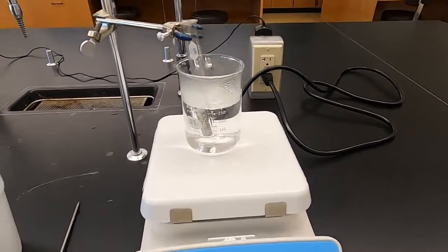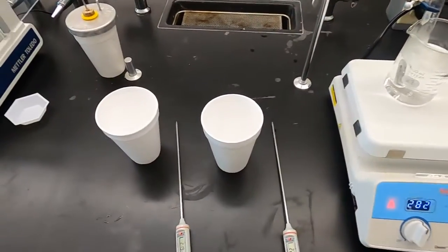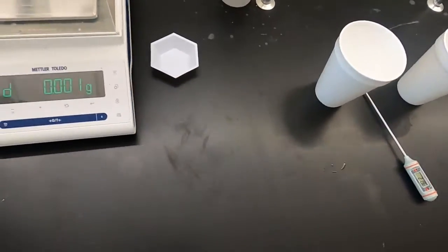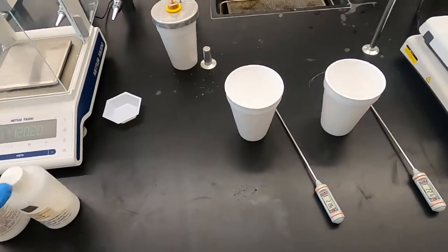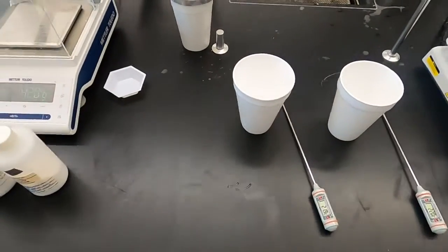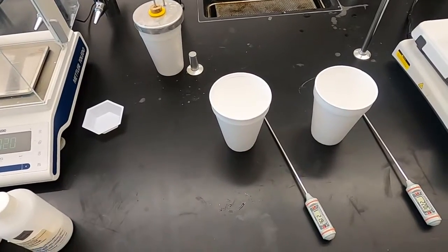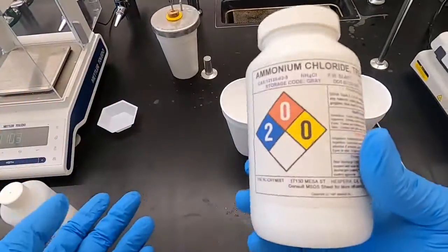We're gonna let this heat at a constant temperature for about 5 minutes. While that does that, we're gonna work on part 2 of this lab. And so for this, normally if you were in the lab, I would give you one of these 3 solids, and you would determine the temperature change. In this, I'm going to give you 2. Your instructor may just assign you 1. If there's no say on it, do both in the sheet and see what each one changes with the water.